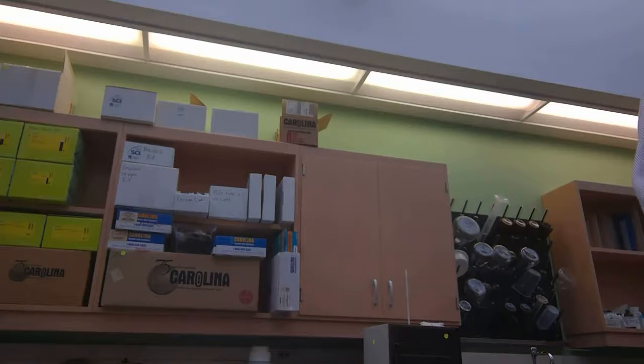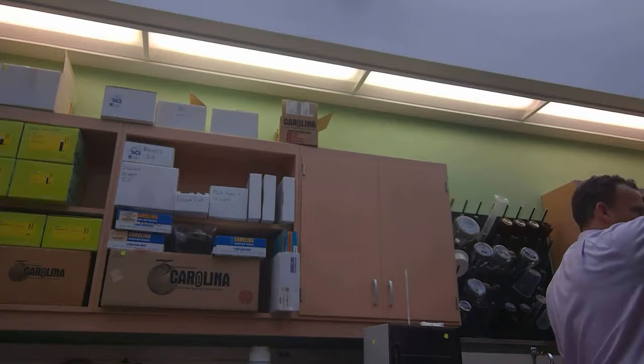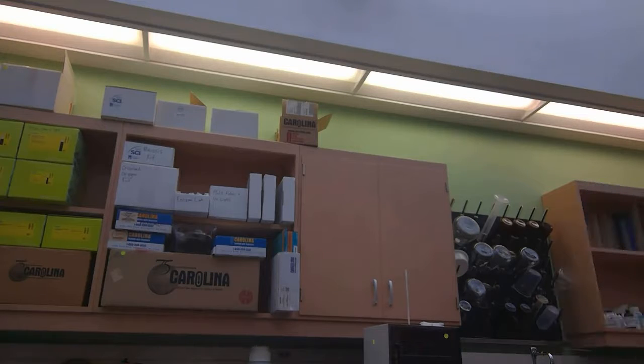What am I supposed to do after adding the Benedict's? Stir it? Is that what the protocol says? 3 milliliters of carbs. Why did you say boil for 5 minutes? Boil for 5 minutes. So you come over to the hot plate. Hot plate is on. Just give me one characteristic of a hot plate. Hot. It's hot. You bet it is. You have to be careful when you put it in there, but you're careful enough that you don't stick your hand into the hot water or onto the hot plate, right? So please use some common sense. That's good enough. So that sample is in being heated.